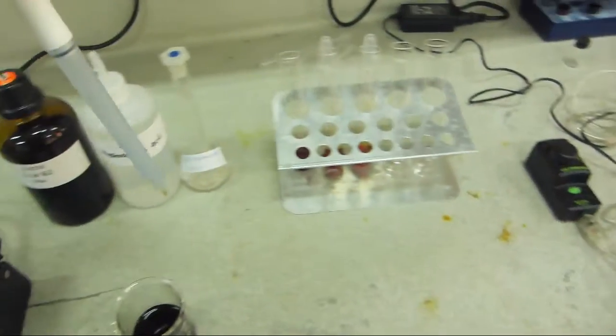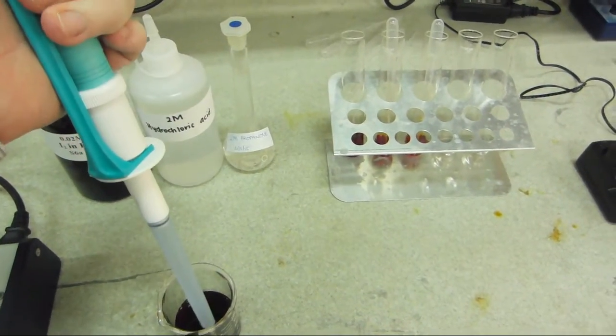Next one, two centimeters cubed of the 0.02 molar iodine solution.